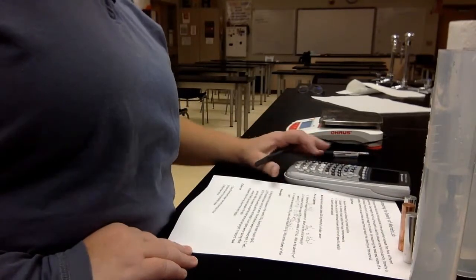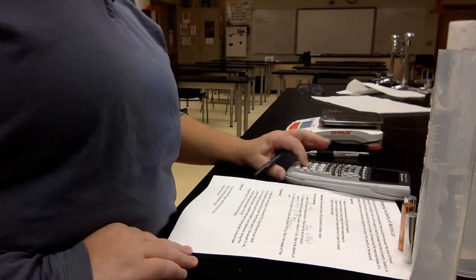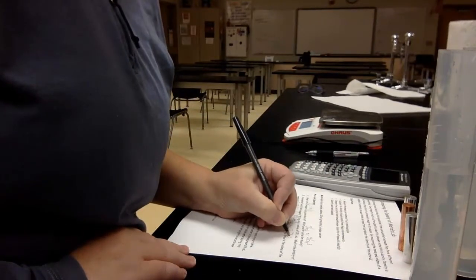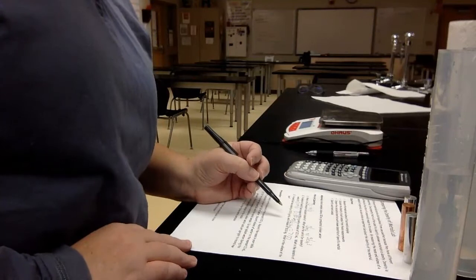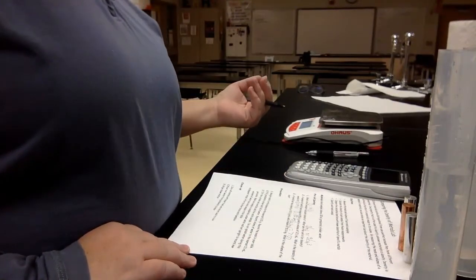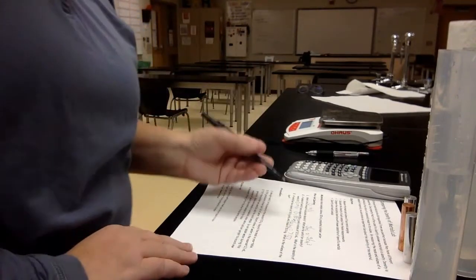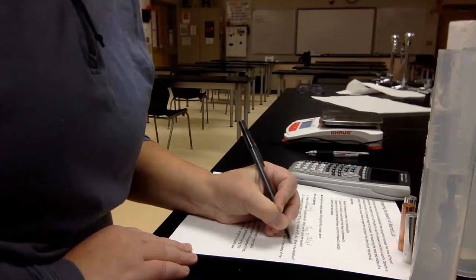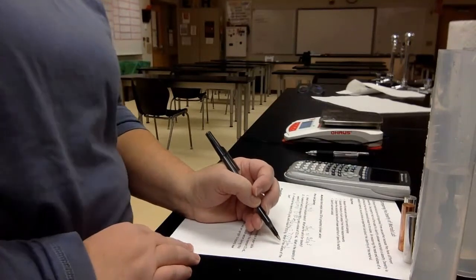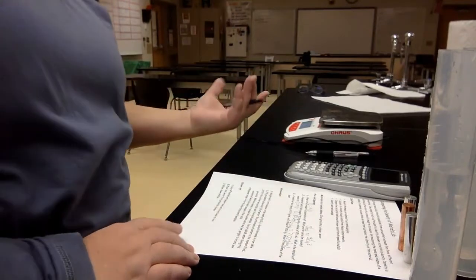So I'm going to use my calculator here. 85.6 divided by 12.1, and I get 7.07. Now we have to look at sig figs. It's actually 7.0743. The next number is 4, so my 7 is all I need to do because that's the least number of spaces. I'll write my units, grams per milliliter. Little m, big L, because milli is a portion of a liter. Capital M, capital L, megaliters means it's bigger than a liter.